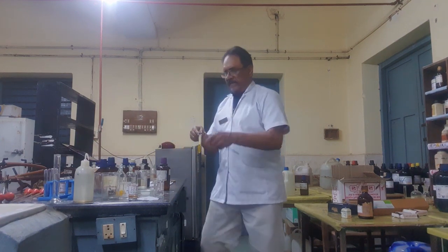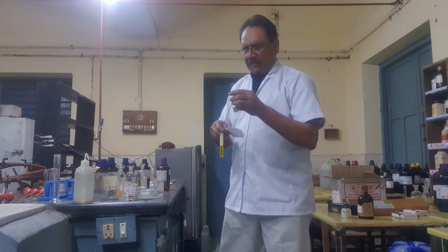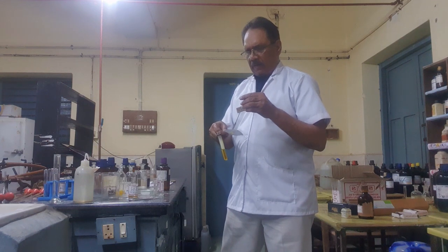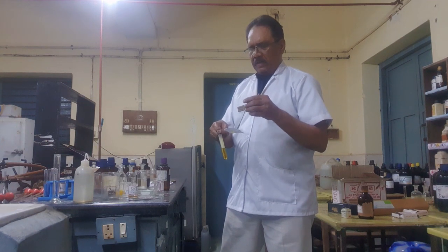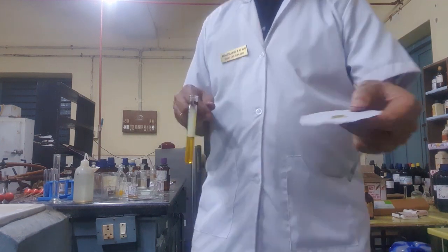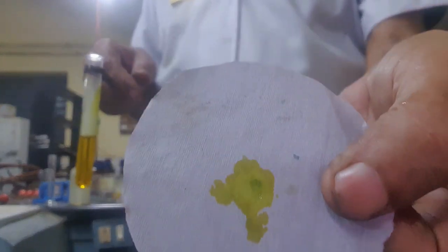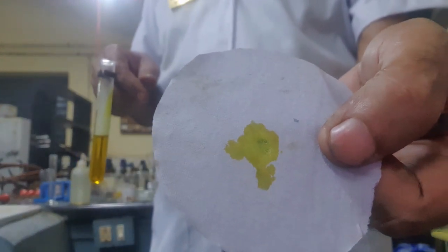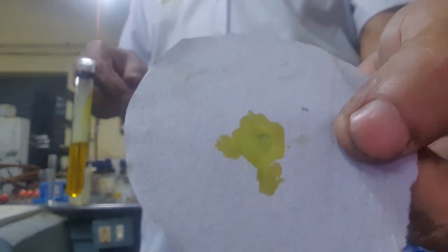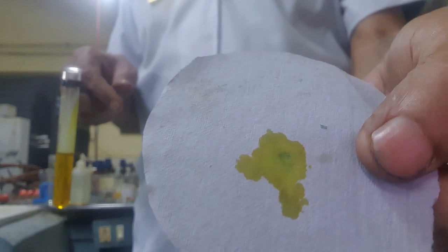Then take a paper and put one drop on the filter paper. You can see the orange stain. It is formed. This is the confirmatory test for the ammonia radical.